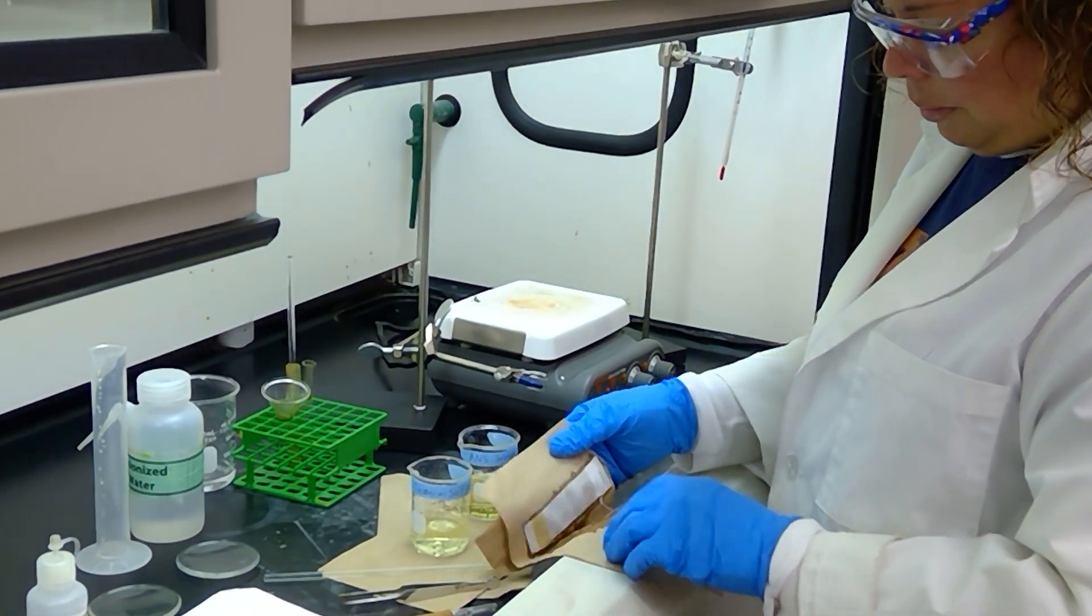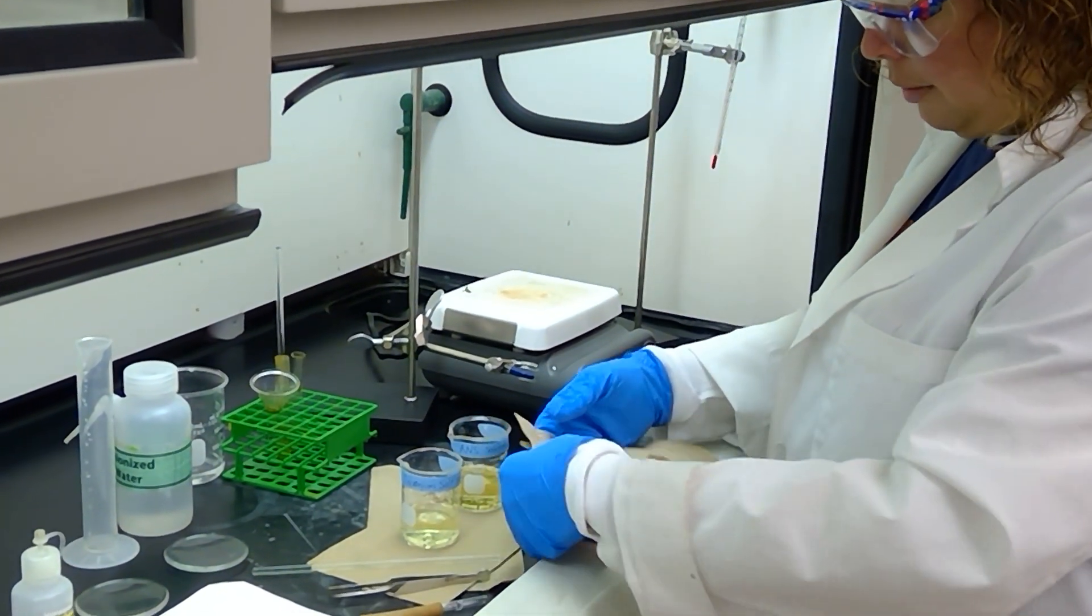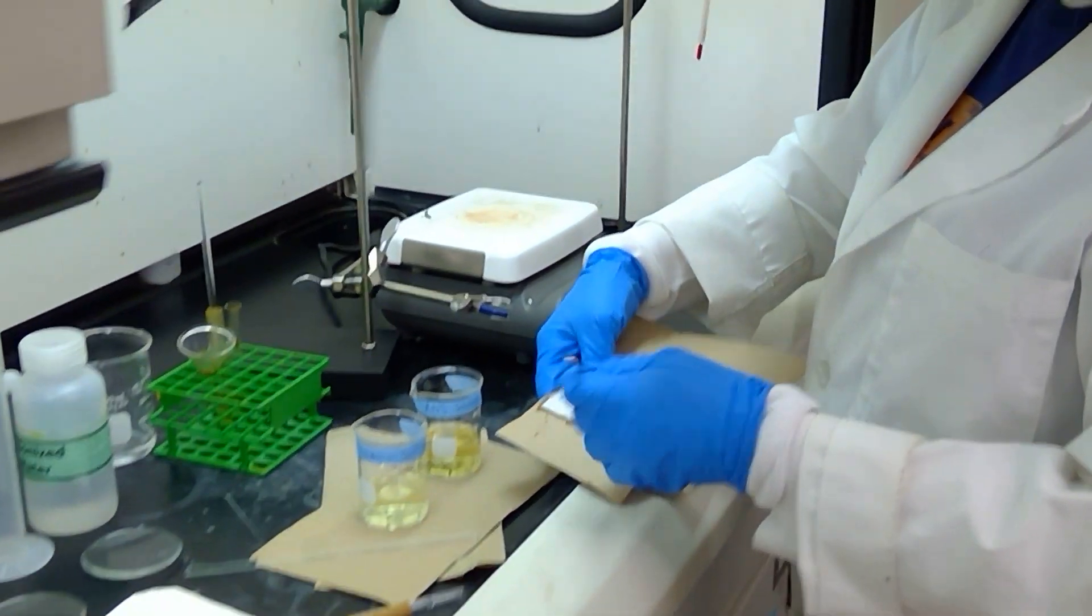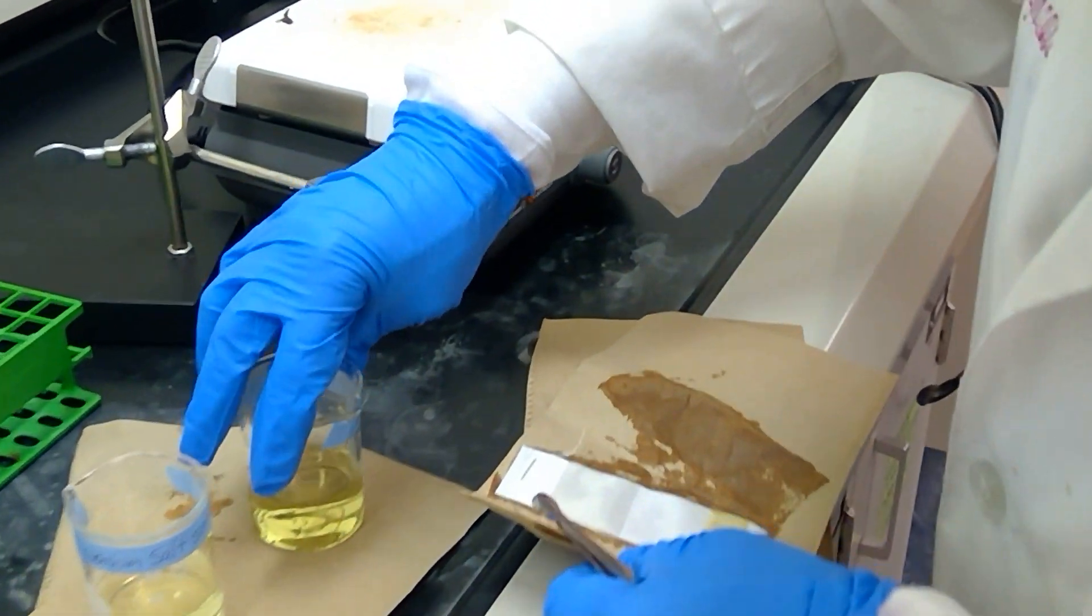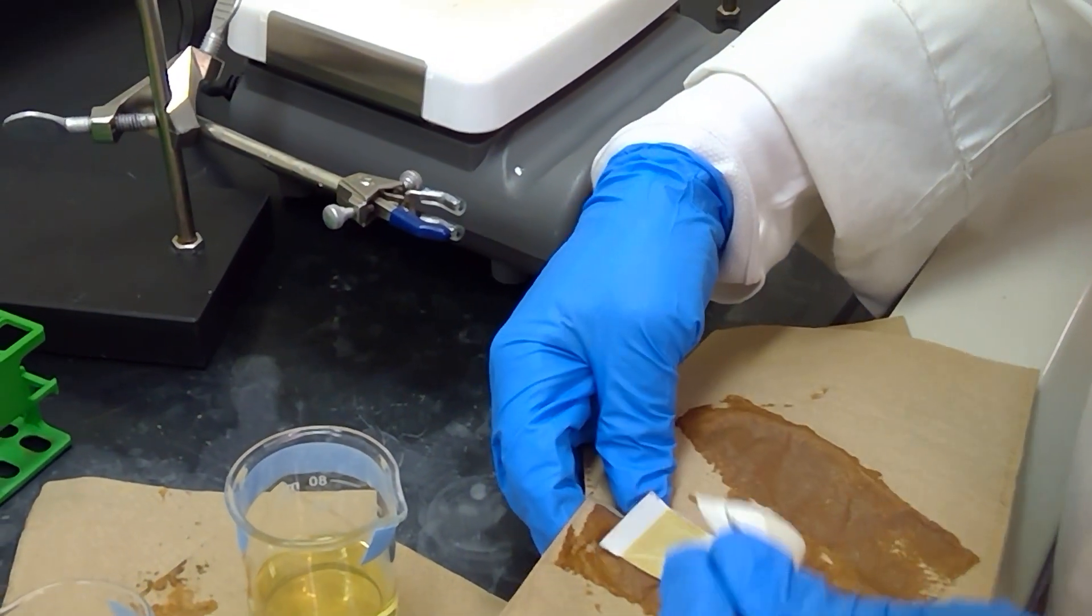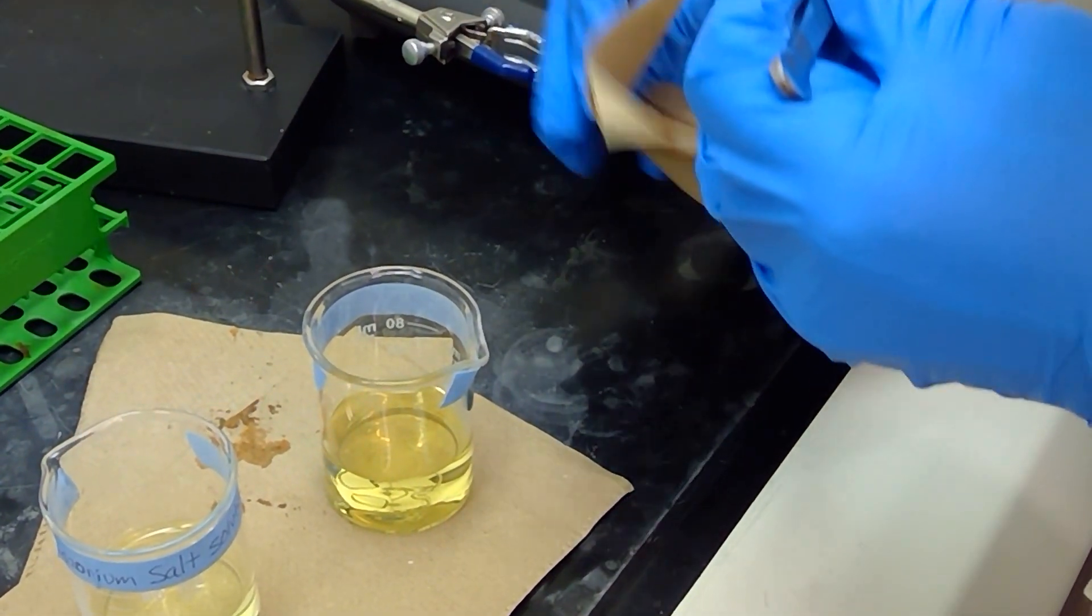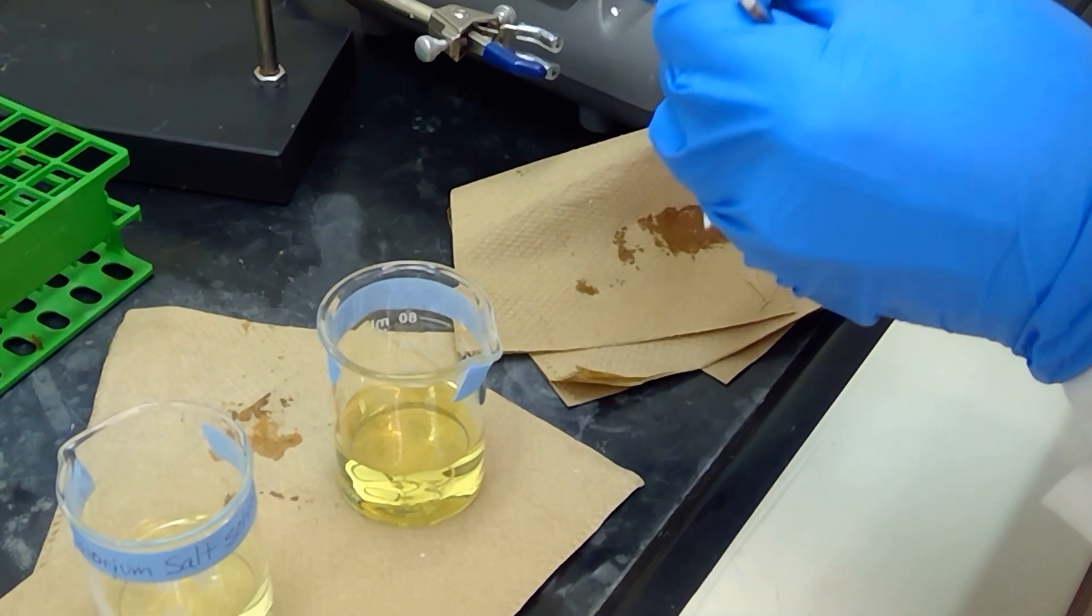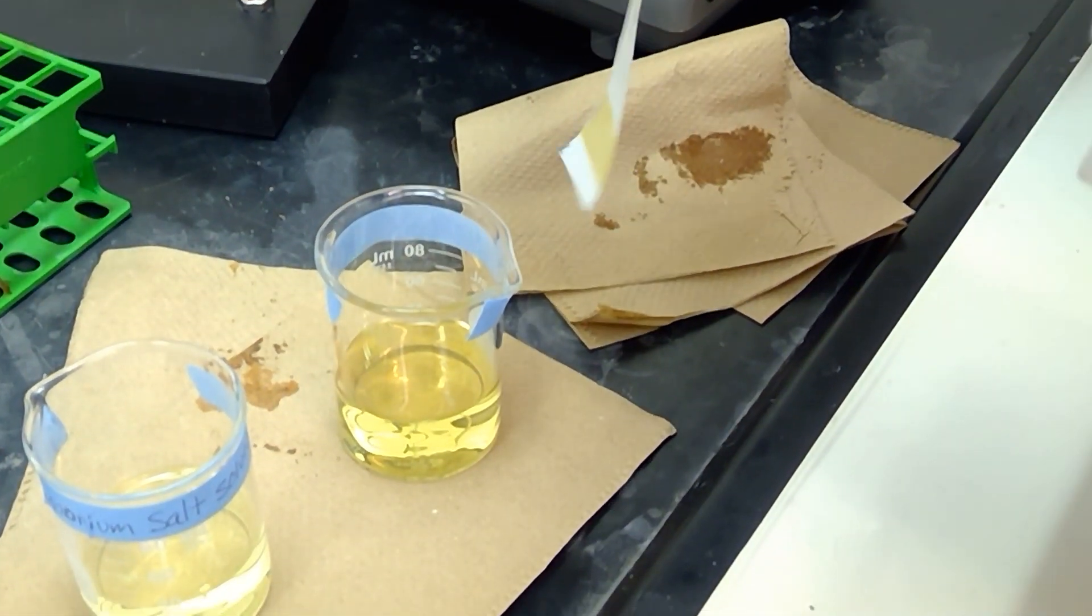Okay, now I'm going to ask Lee to bring the camera a little bit closer so that you can observe this reaction in real time. So our next step is to add the fabric strip to the solution of ANS, and the ingrain coupling, the coupling reaction should happen immediately.